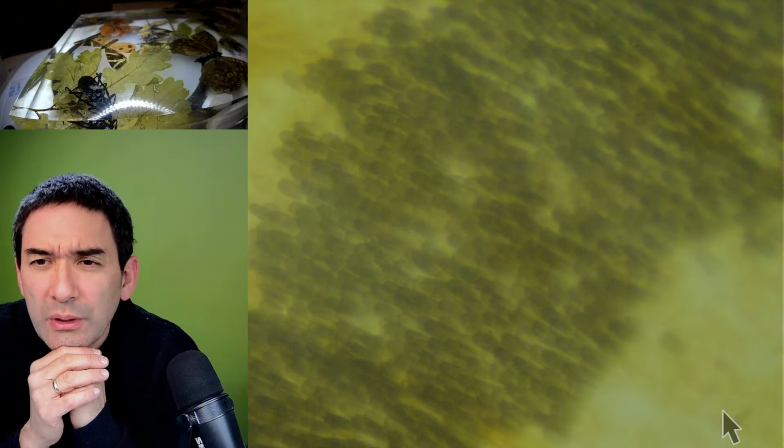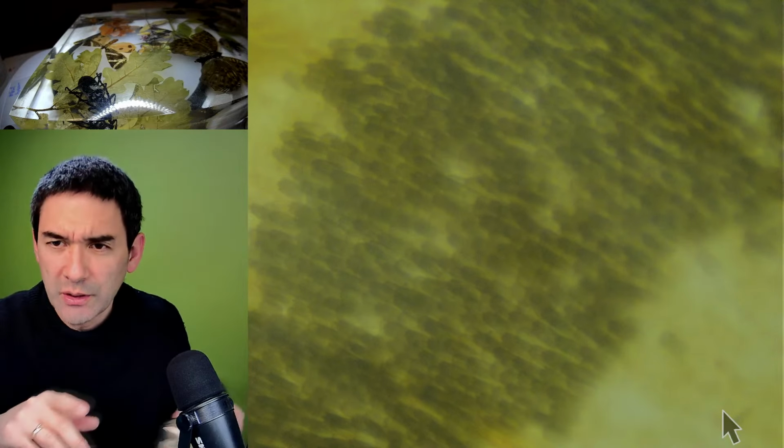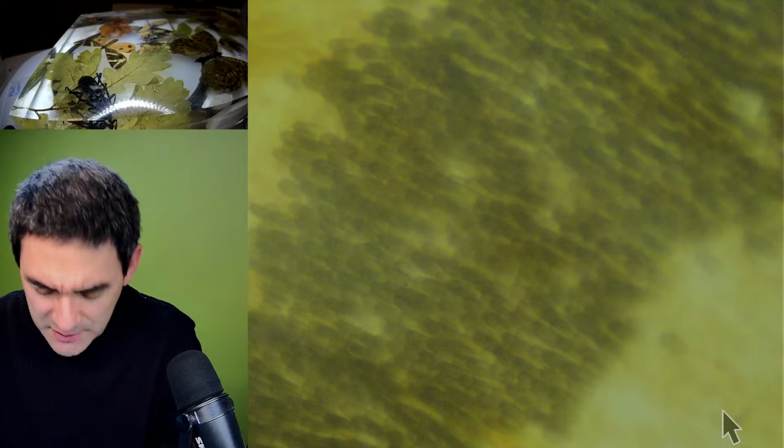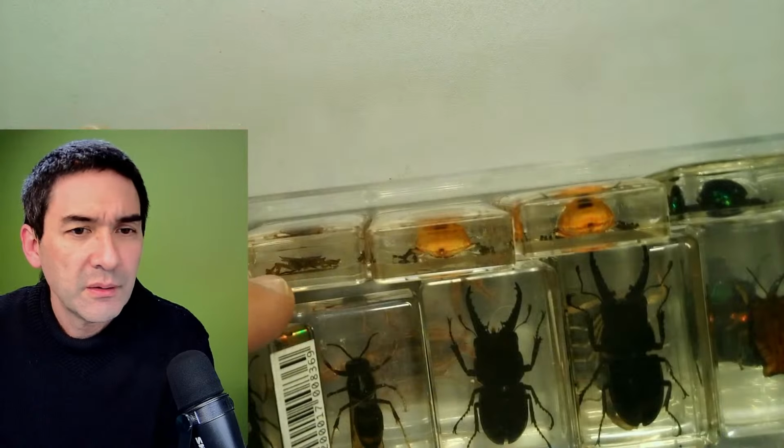Could we see the green one again? The green one. Which one? Were you talking about one of those here? Marie was asking, I don't know.